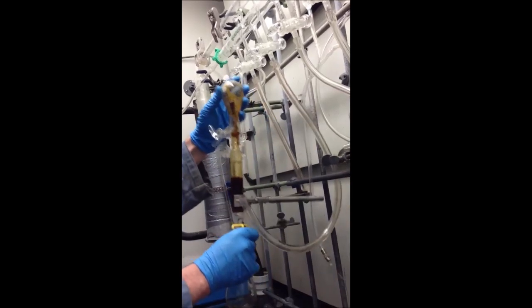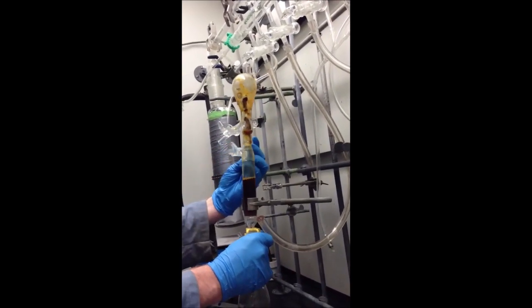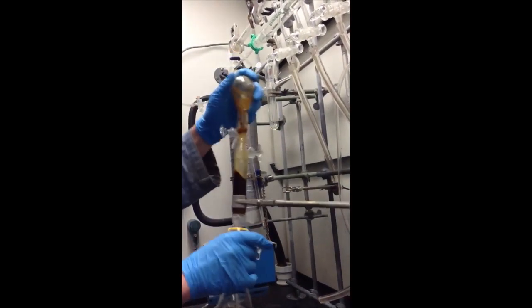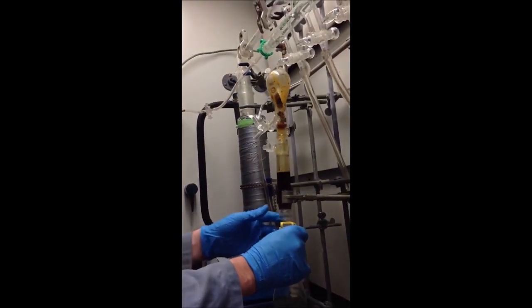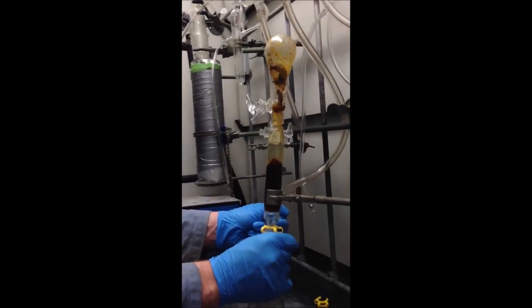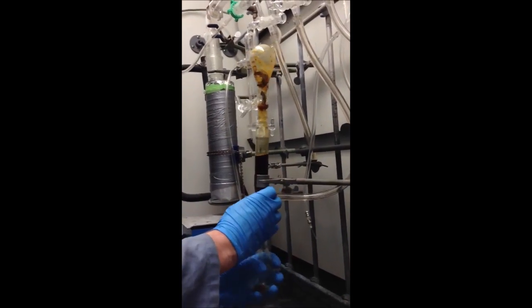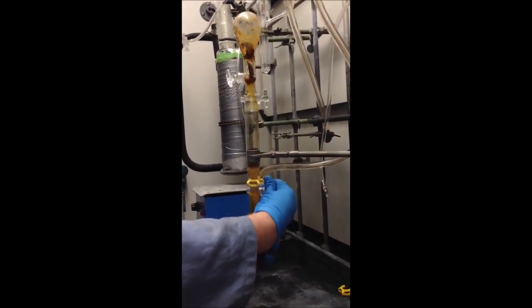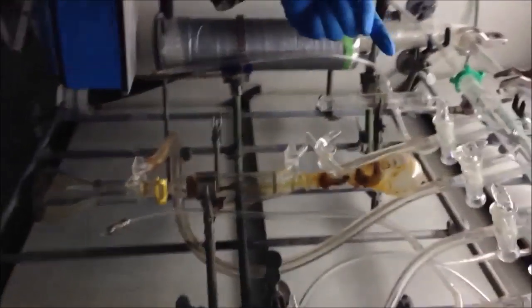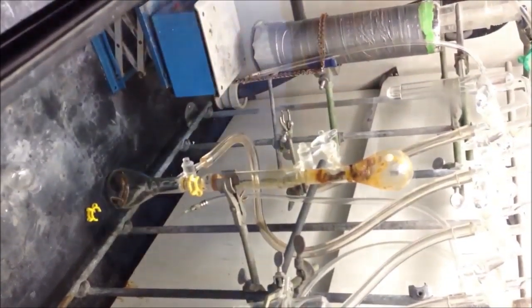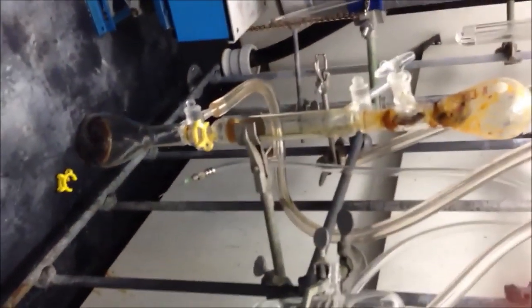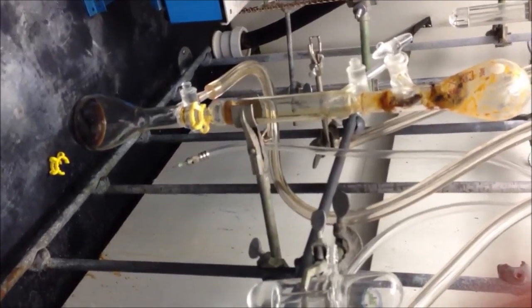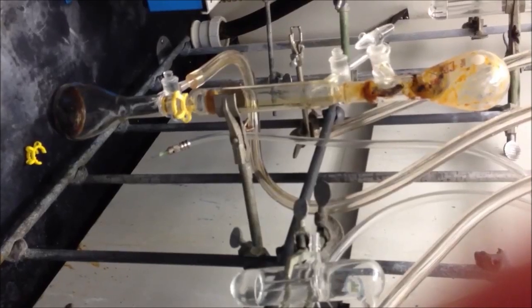Oh, great. That is a really large ring of solid. Okay, so at this point we can go ahead and suck down our liquid. And we do that by applying a little vacuum. Nice. Now we need to figure out how to break up these solids without disturbing too much. Now you see we've already collected a fair amount of our material down there. And that's good. This is what we're going to be collecting. However, we've got a considerable amount upstairs that we need to break up and flush downwards. So for that, we're going to take a quick break and we'll be back in a few minutes.